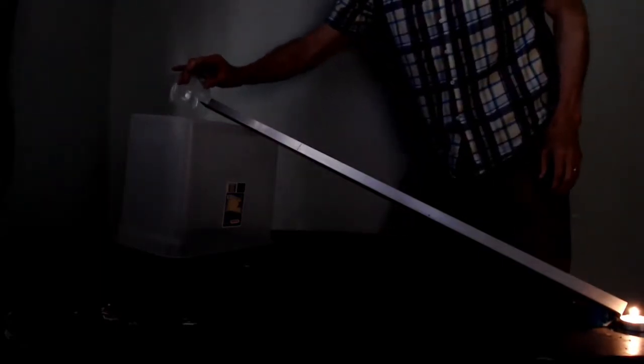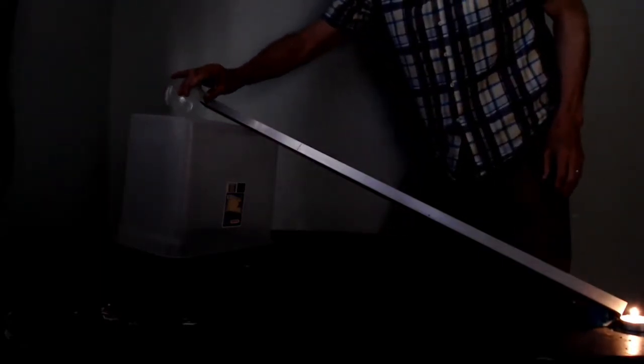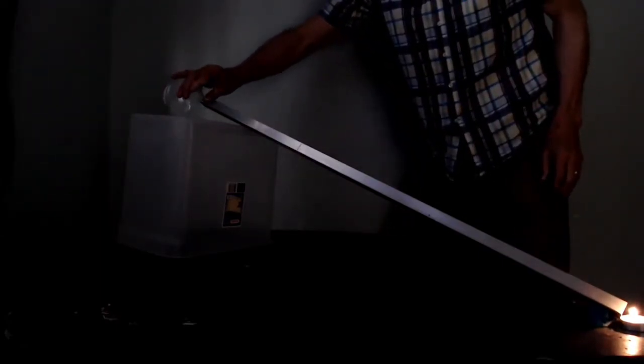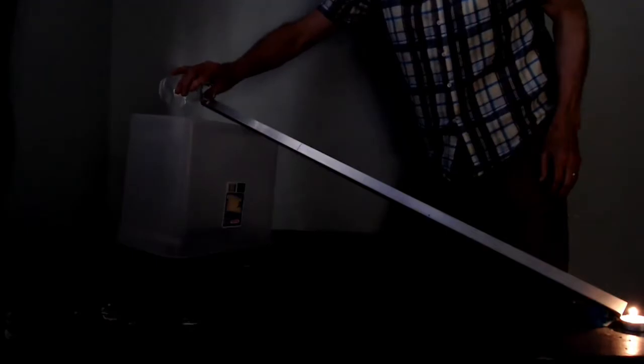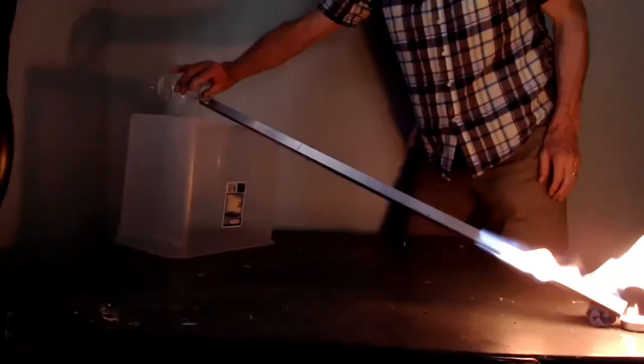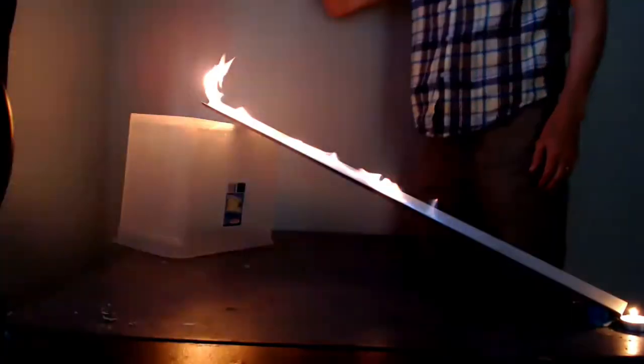So kind of weird pouring something I can't see, but I'm starting to pour right now and hopefully it's going down the ramp. And it worked! So the vapor went down here, the gas went down, reached the candle, it ignited the gas.